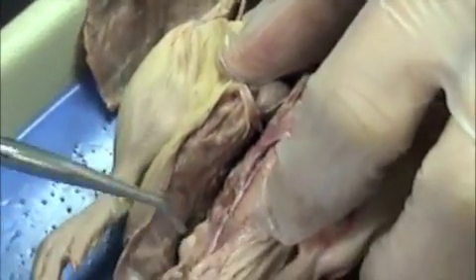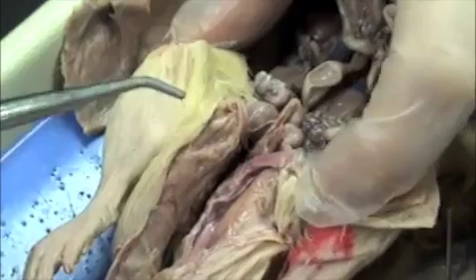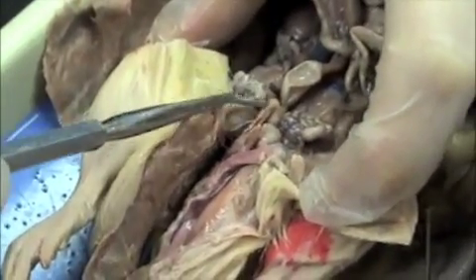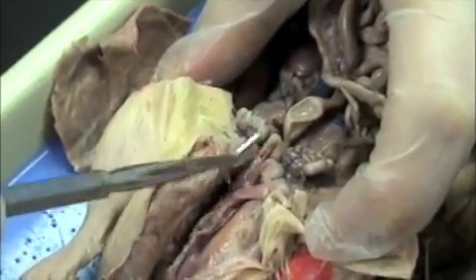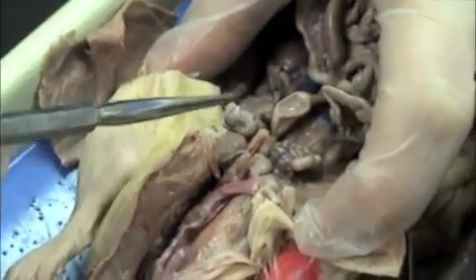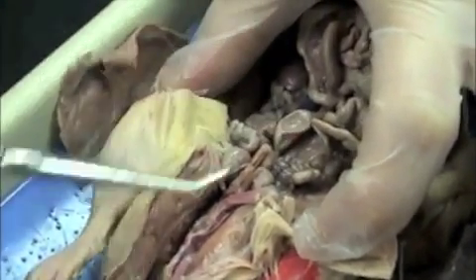I think I can find it on the other one a lot easier — we'll get to it over there in just a second. That's it right there, you just can't see it very well. This is the bladder. This is the prostate gland here; it surrounds the lower portion of the bladder. These little curly structures here are the seminal vesicles.